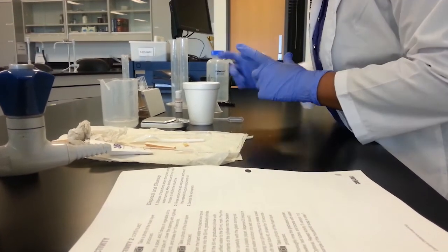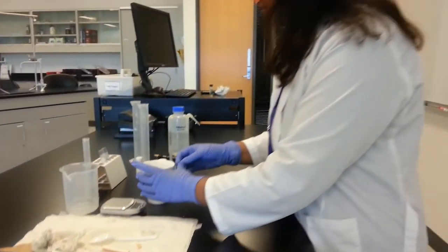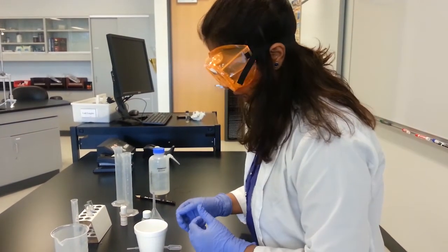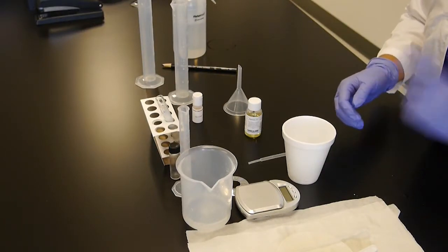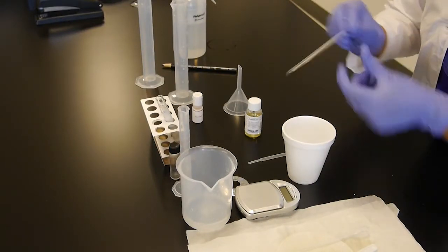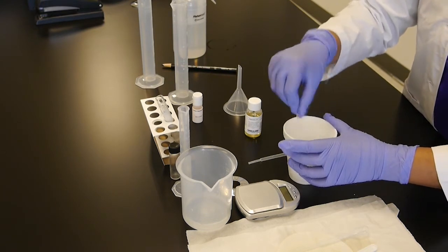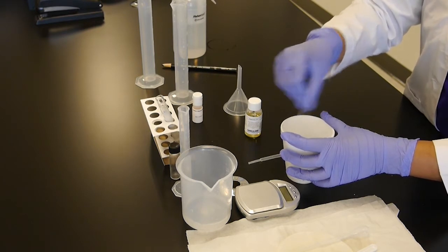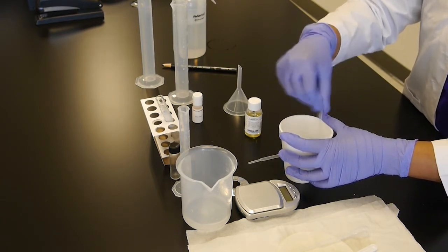Okay, next, let's use the hard water mix that was given in the lab kit. Pour it into a beaker or a plastic glass that was provided with the kit. Add about 50 ml of water in it. Make sure to mix it well. We're going to test how the soap reacts in this hard water mix, this basic solution.